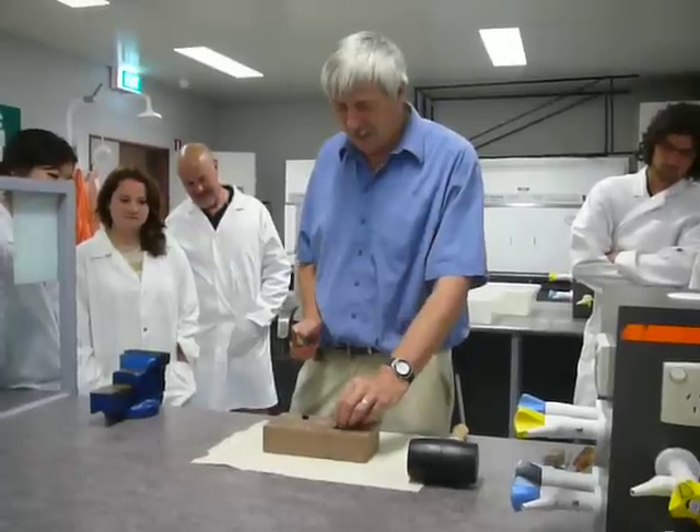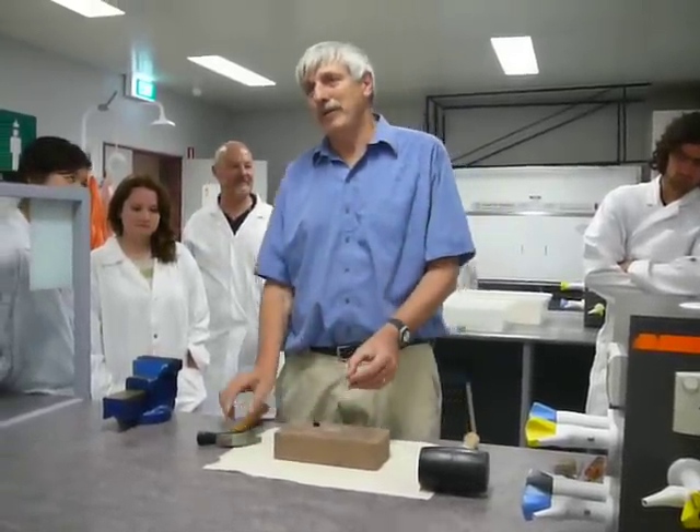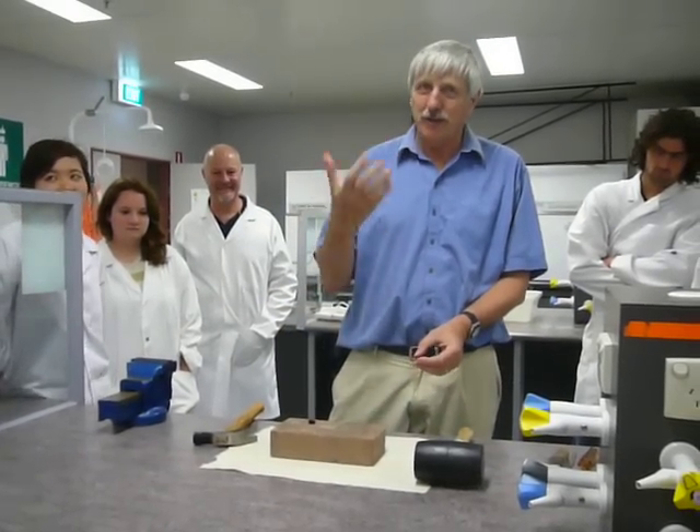I've just got it there — you can see it's cracked a little bit. You might have to give it an extra little tap. But the whole idea is just tap it hard enough to break the shell, alright? Not to squash the whole animal.